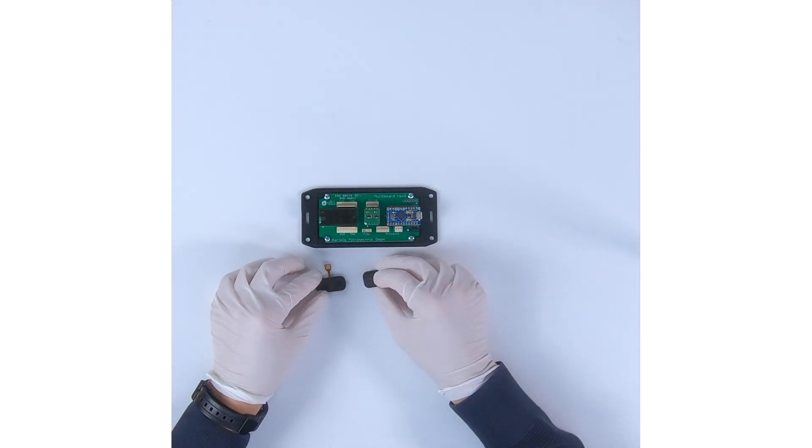Let's switch to the fluidic components, the micropump. In this case I connect the MP Damper and the liquid flow sensor. I need to screw the tubing connectors into the liquid flow sensor.